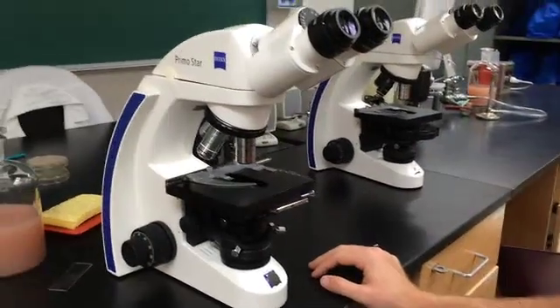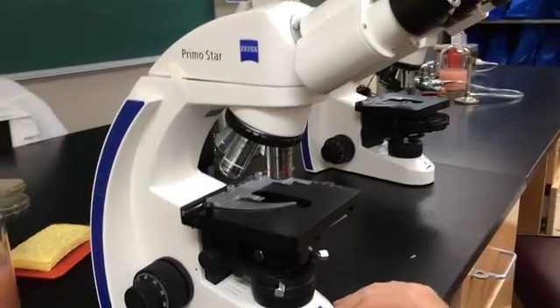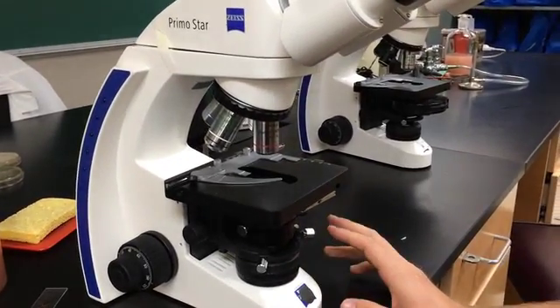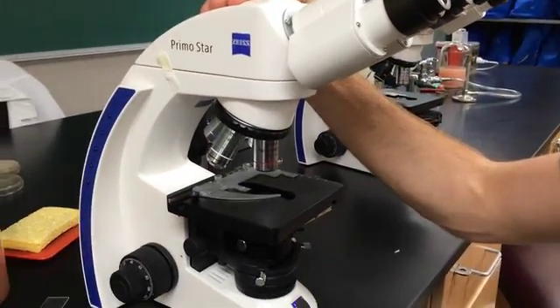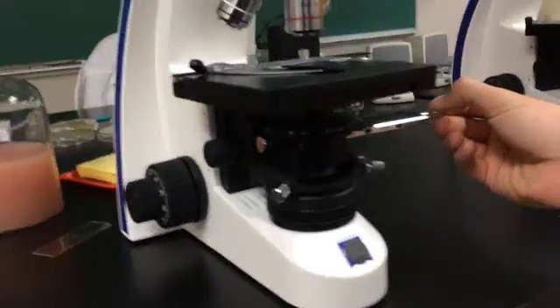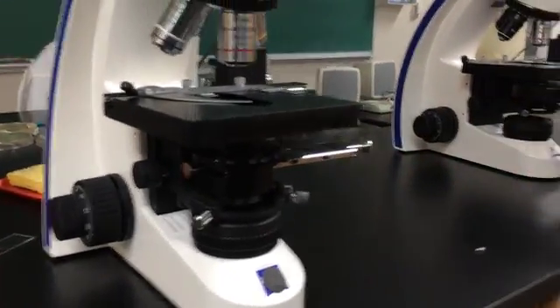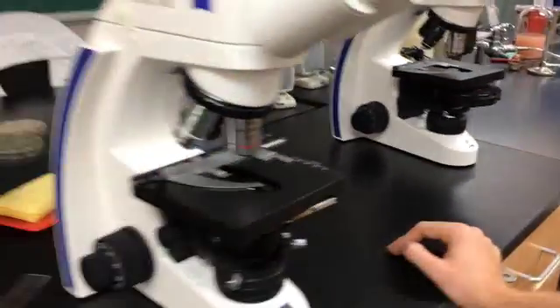Alright, so in this video I'm going to show you exactly how to set up your scopes so that you guys all know and you can use this video to study. This video is for aligning the Zeiss Primo Star, the one with this sliding condenser adjustment right here, and also on this scope I have the one with the disc. So I'll show you both, they're just subtly different.